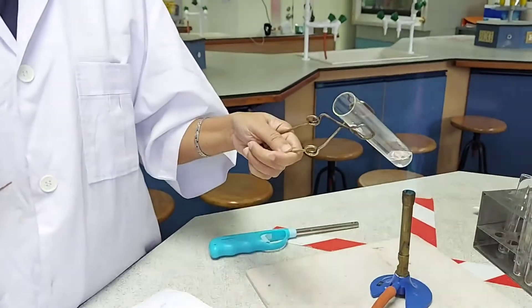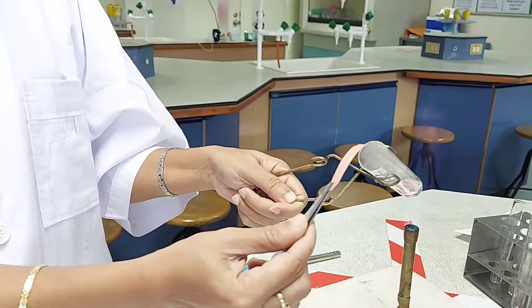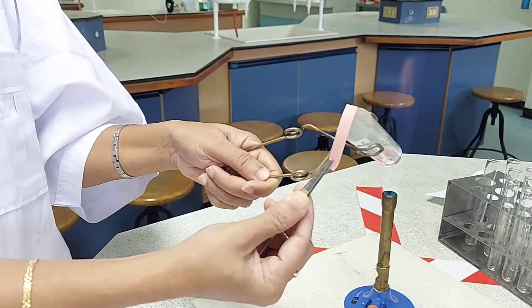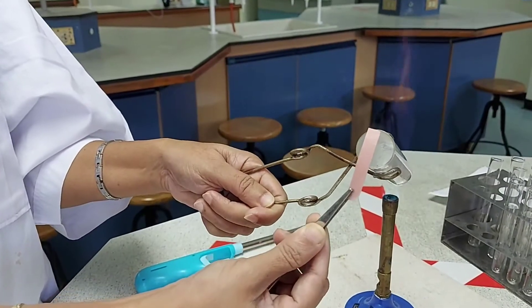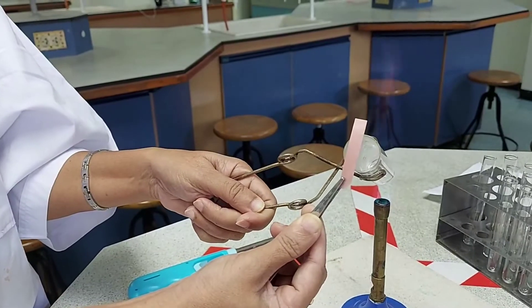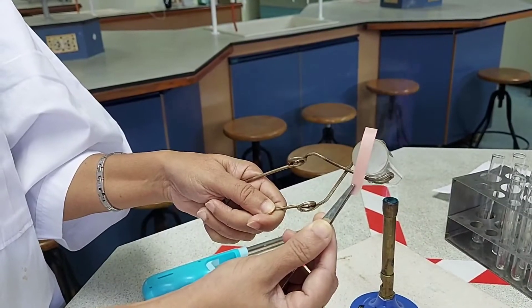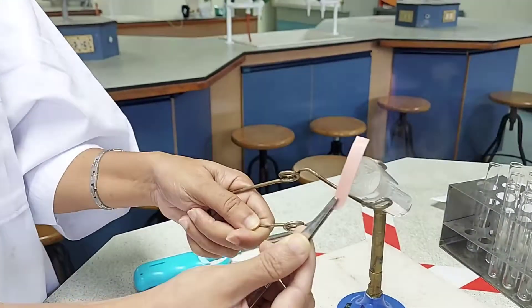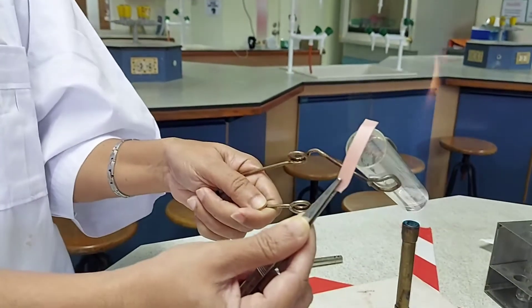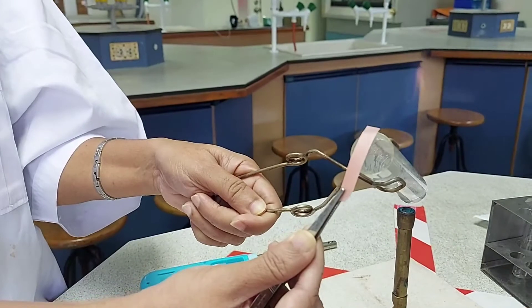A gas will definitely be evolved, and I will be testing the gas with a moist red litmus paper by holding the paper at the mouth of the boiling tube. You can clearly see a gas is getting evolved, and the red litmus paper is slowly turning blue.